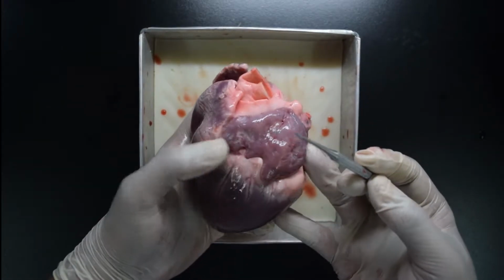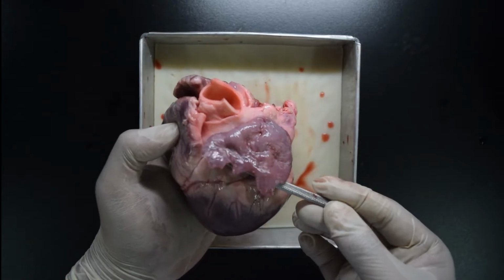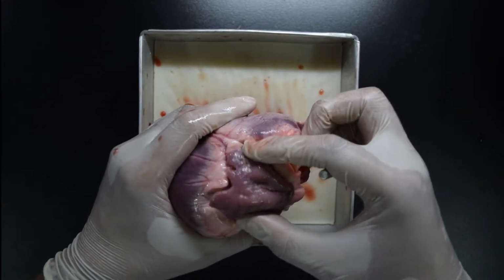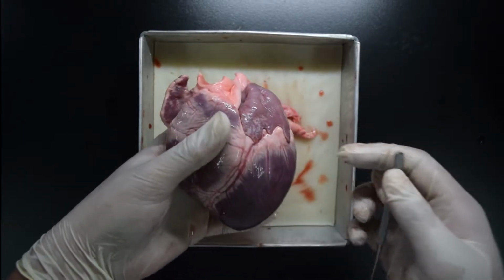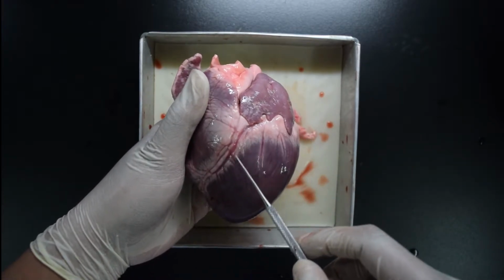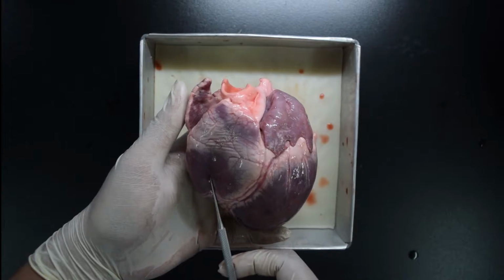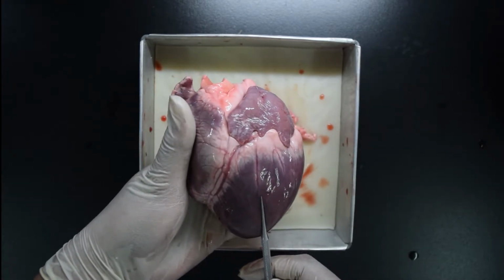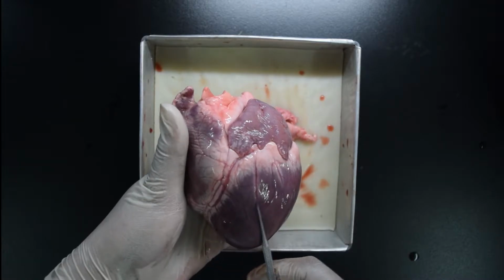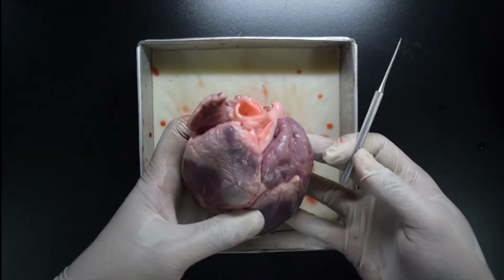On the other side, we have the left part. This part is your left atrium. I will show you the back side of the heart. This is the left atrium. Next, how about the ventricle? This big portion of muscle is your left ventricle. Compared to the right ventricle, your left ventricle is much bigger because this chamber will supply the oxygenated blood throughout the body, so it needs to be more muscular than the right ventricle. Those are your 4 chambers.